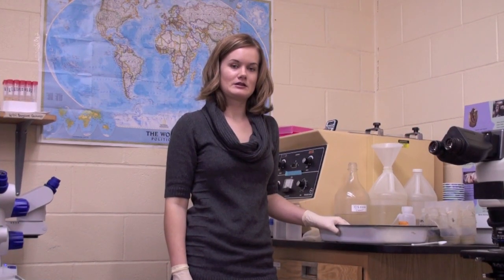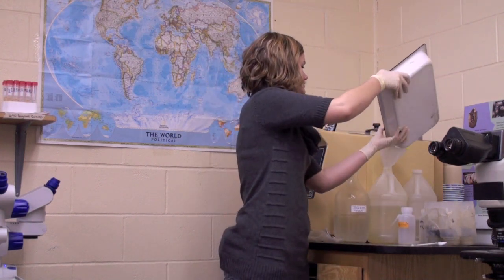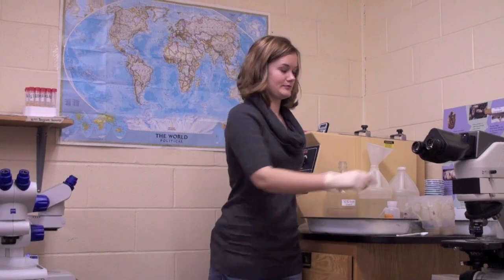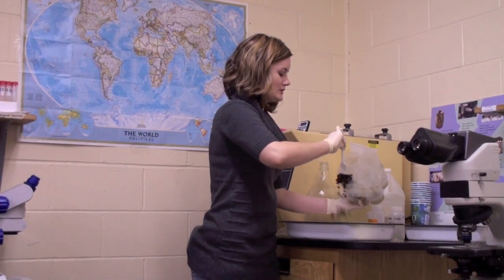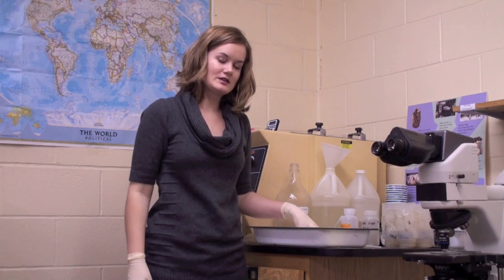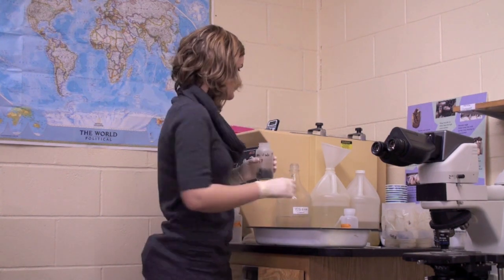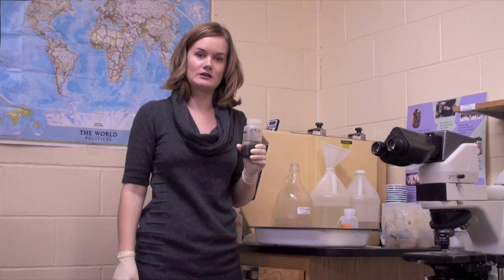We've collected our mites and are saving them in a subsample tube. The next thing we're going to do is pour out the alcohol through our filter and now we're ready to count bees. Our bees have been sitting here in the tube, we're just going to scoop them out. We count the mites and the bees so that we can do our analysis and send you accurate data. We put the bees right back into the same bottle, fill it up with clean alcohol, label the bottle to say that we've completed our varroa test, and we move on to the next test.